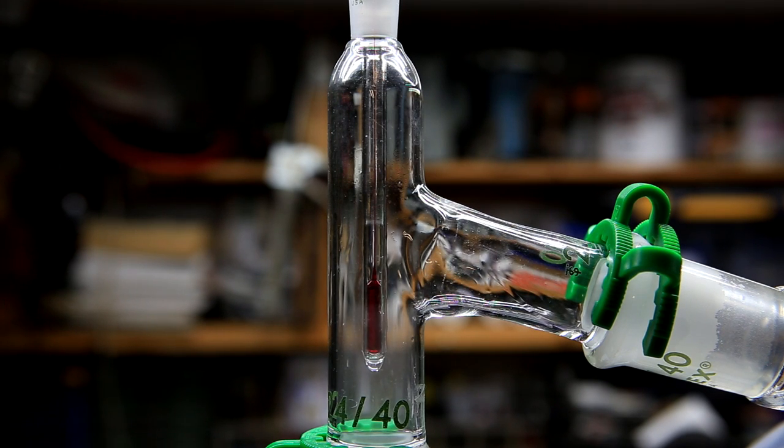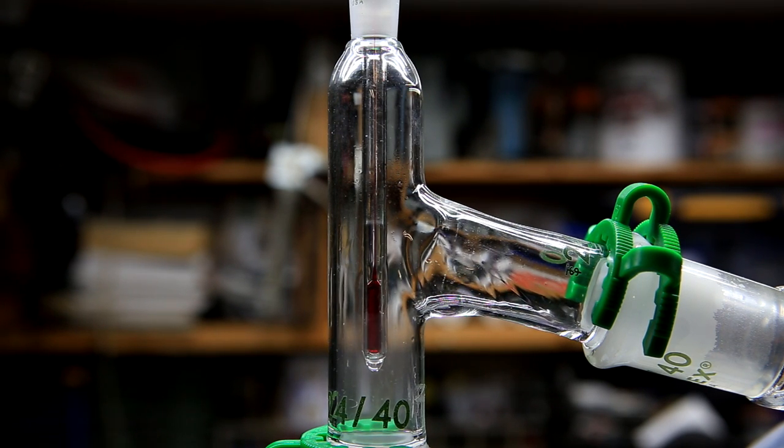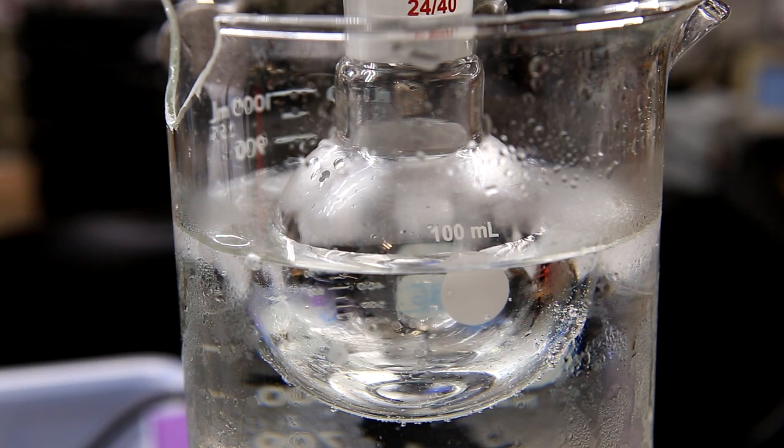Eventually, some propionaldehyde vapors will make it past the hot condenser and make it towards the cooling condenser. Eventually, we'll receive a first exciting drop of propionaldehyde product. To limit loss of the propionaldehyde, I place the receiving flask in a cold water bath.